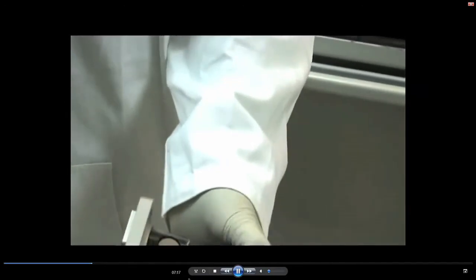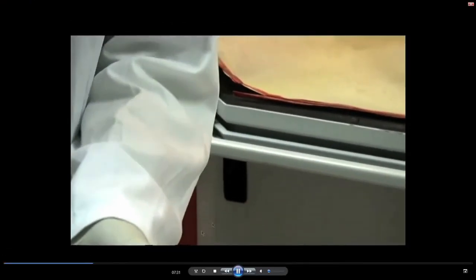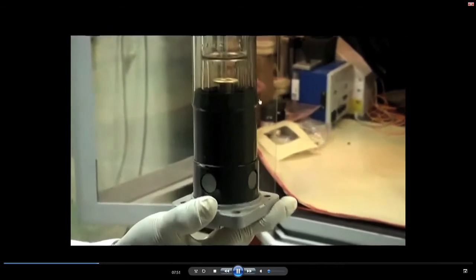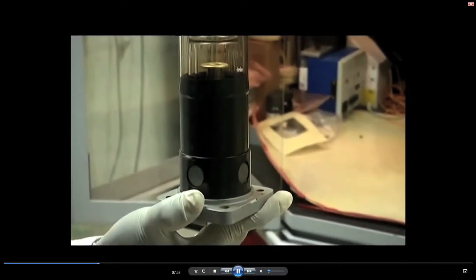What we are now seeing on the screen is the X-ray tube. What is a typical X-ray tube one would look at? Now you have a better view. This is an X-ray tube where you have the target material inside, and later we will also open this and show you some of the details of the X-ray tube, so that you have some idea how it looks. It goes into that source which we have just shown.